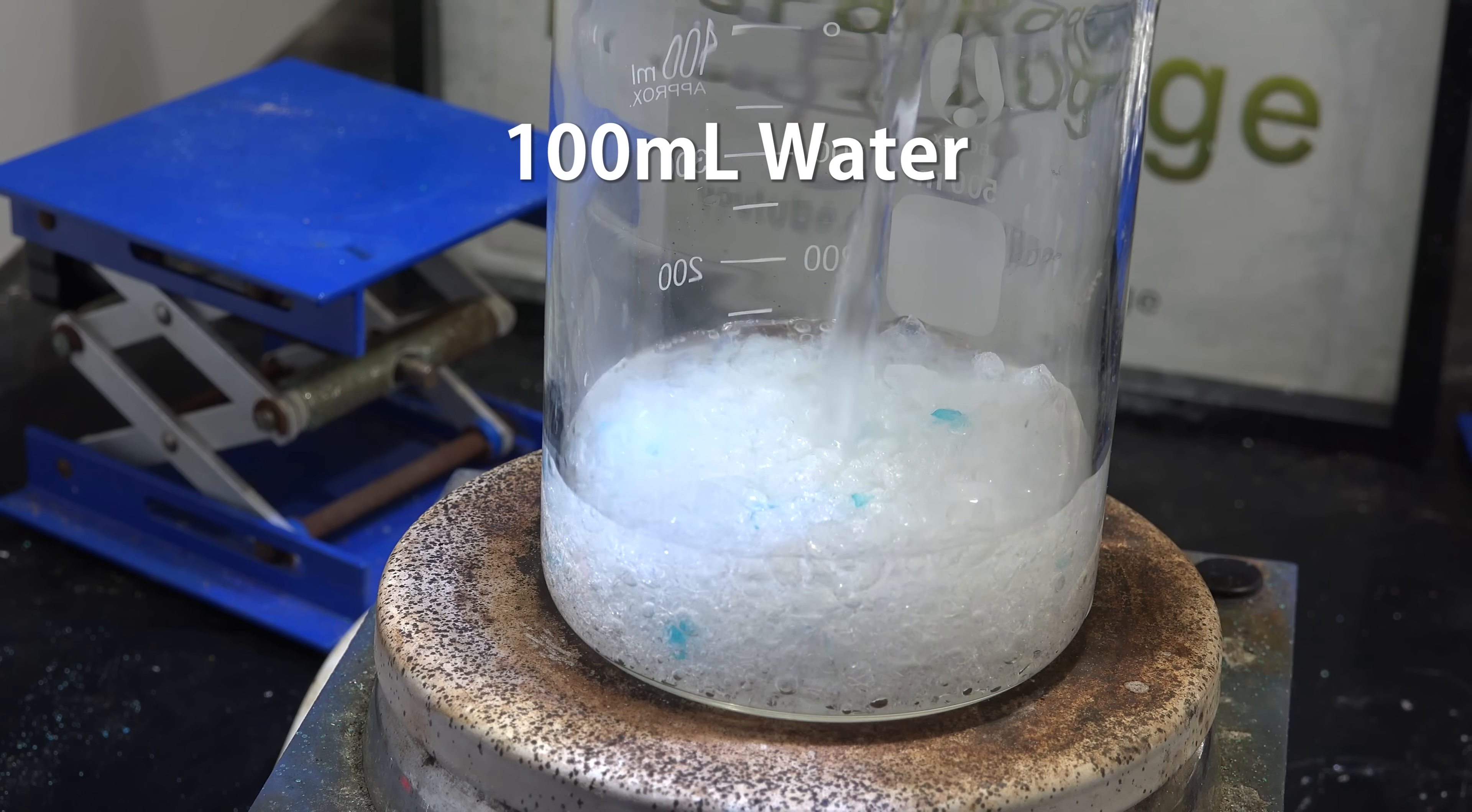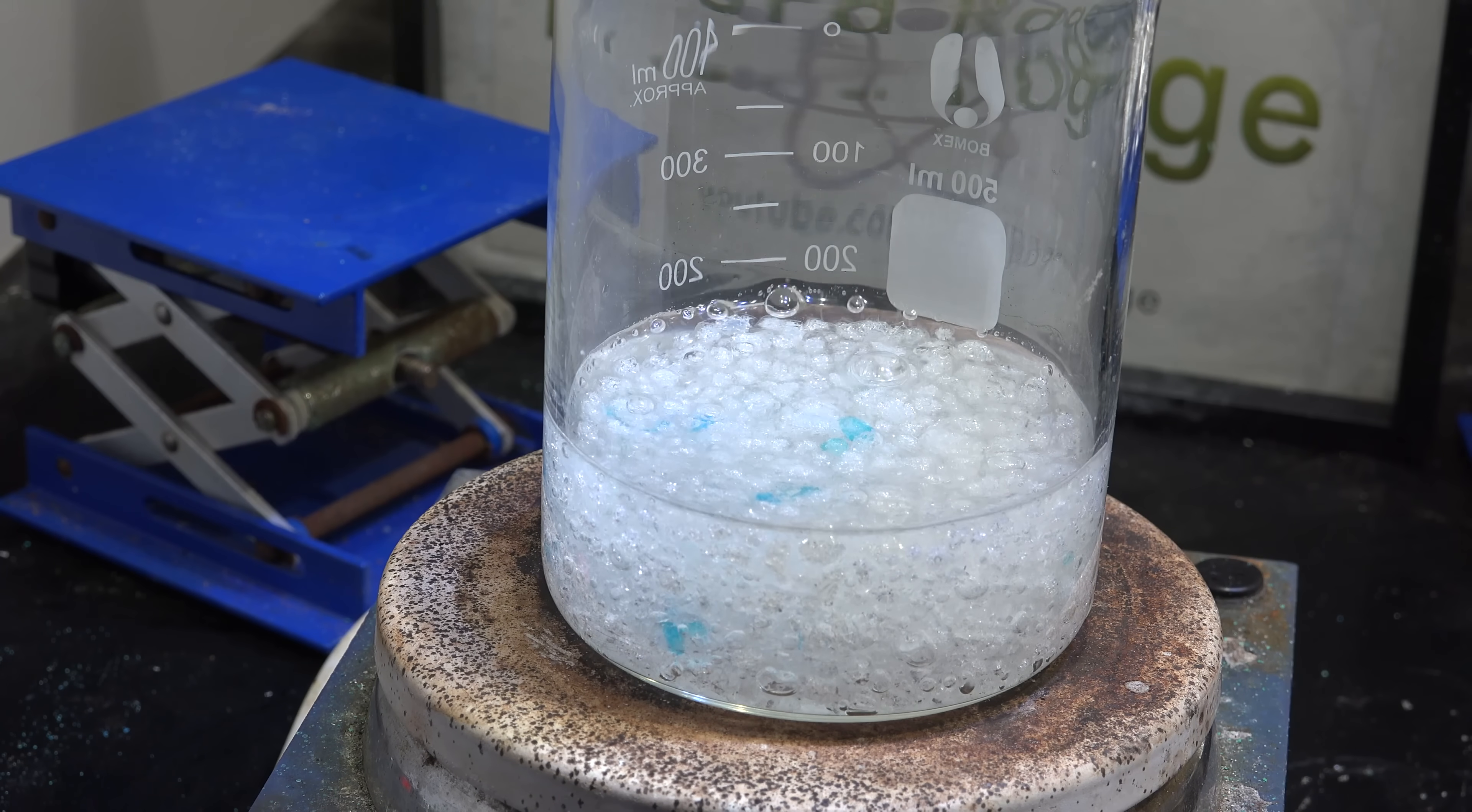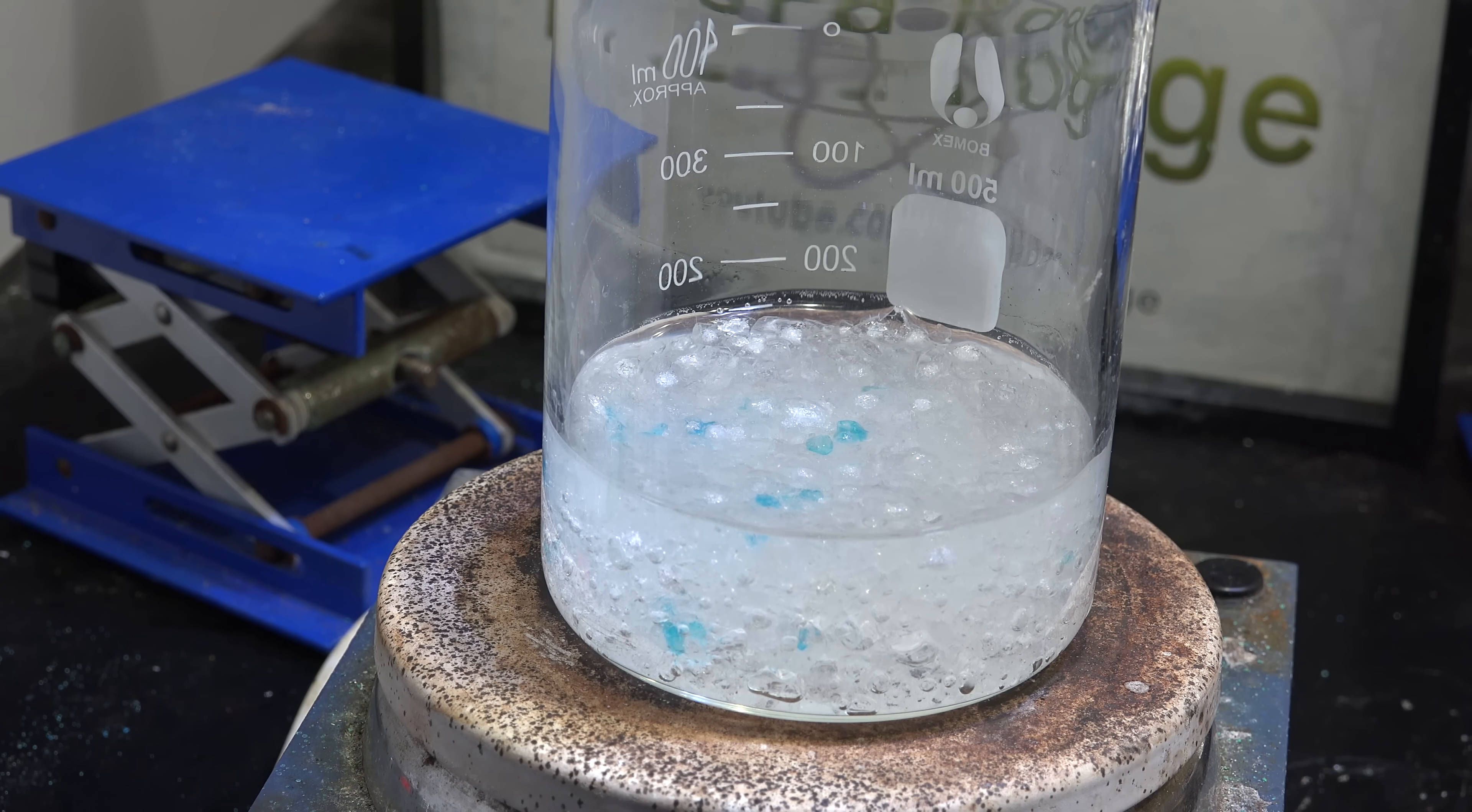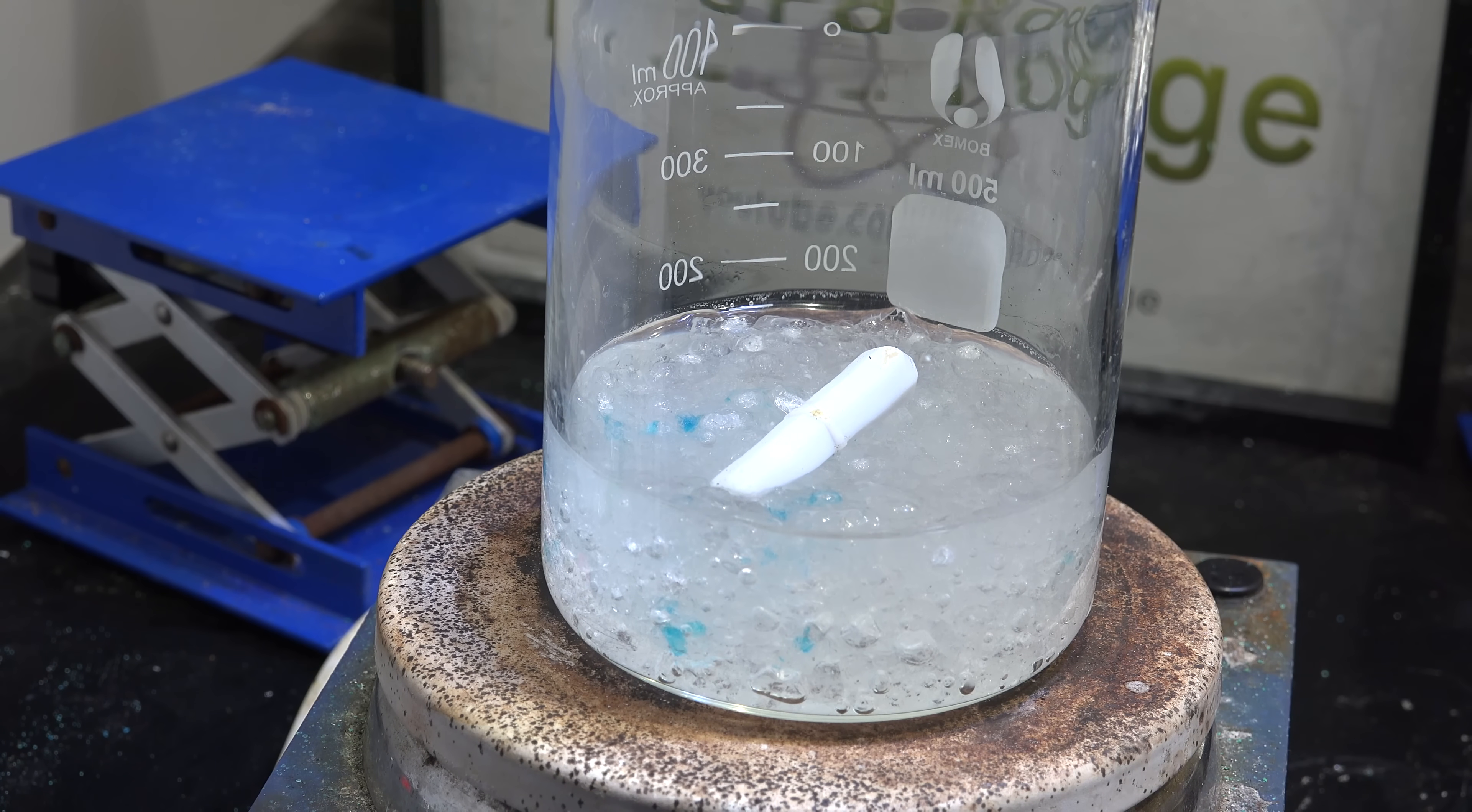It may bubble, but that's just air inside the silica gel being forced out by water. It's not actually boiling. You might be wondering why the blue indicator particles are still blue. The color change is actually quite slow since it takes time for the water to diffuse in. I found I had to leave it overnight before any significant color change was visible.